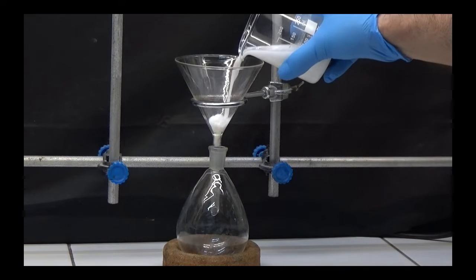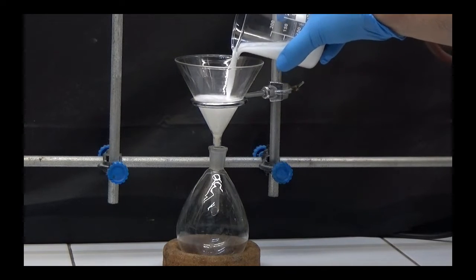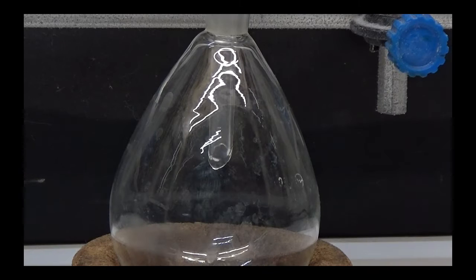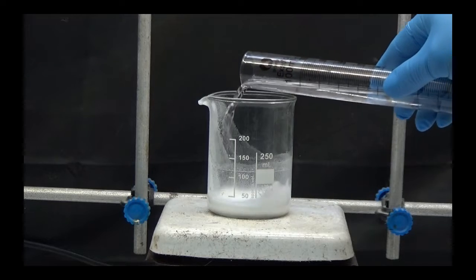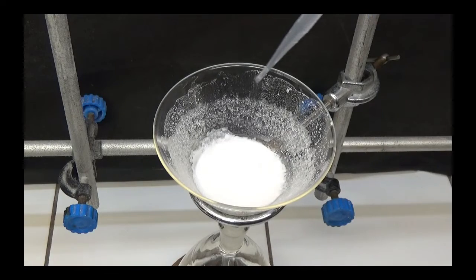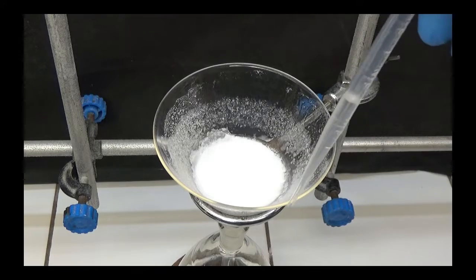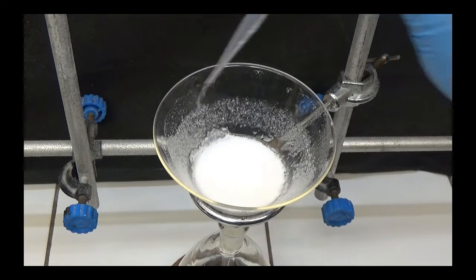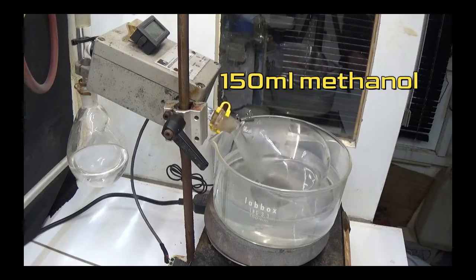We filter to separate the excipient from the tablets. Then drag the contents of the glass with 50ml of methanol. Wash the solid from the filter funnel with 50ml of methanol. 150ml of methanol has been used in total.